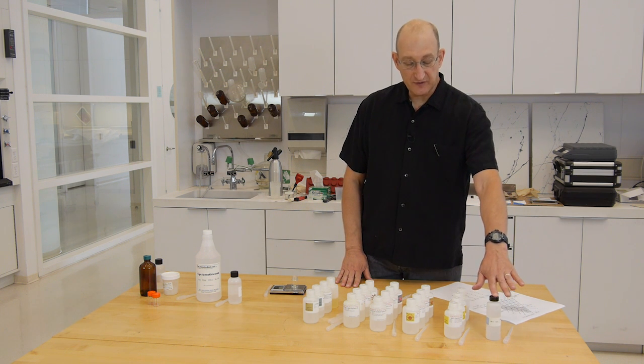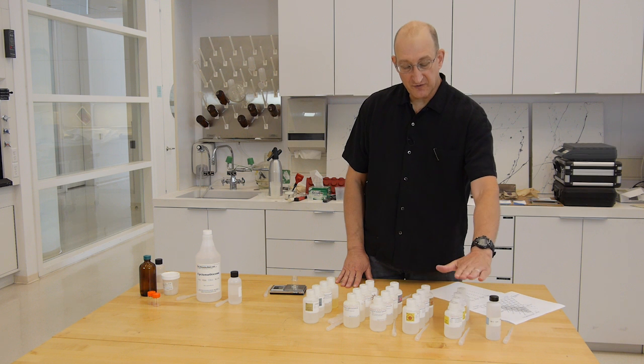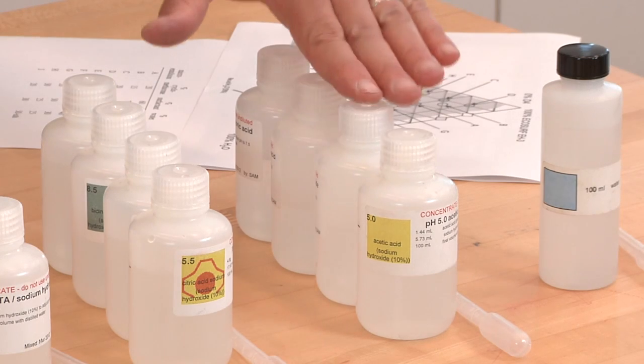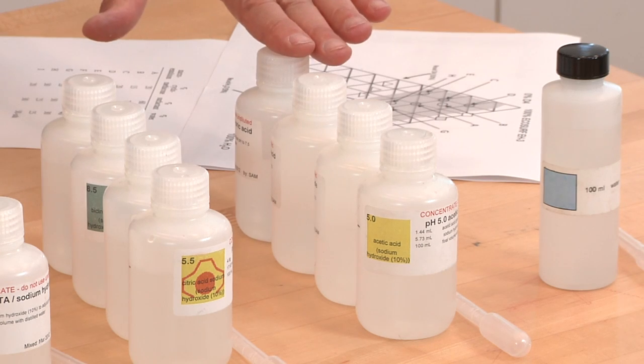We have the distilled or deionized water. Our buffer is ranging from, in the case of acrylics, from 5.0, 5.5, 6.0, 6.5.